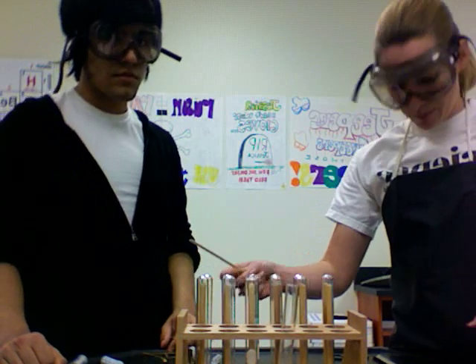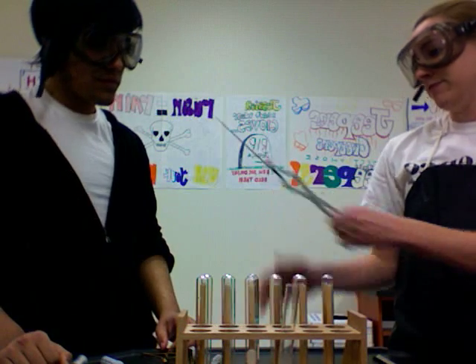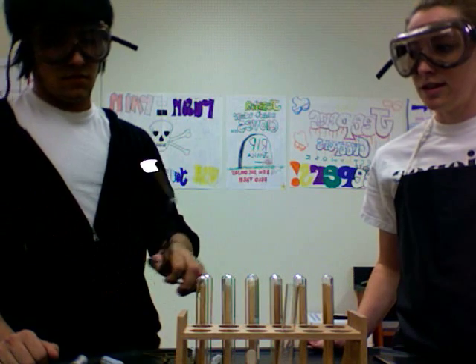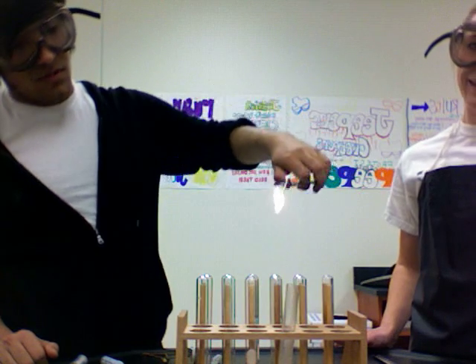Or at least we're pretty sure it's hydrogen, but we're going to test it by setting the sucker on fire. Just getting the splint lit and then we're going to insert it into the mouth of the test tube — and there's our reaction.